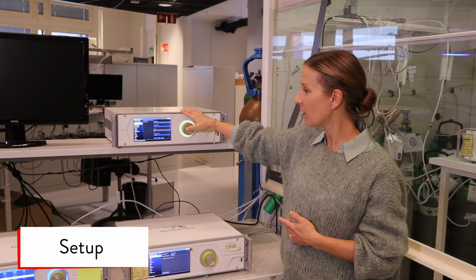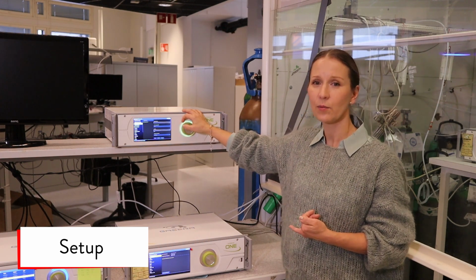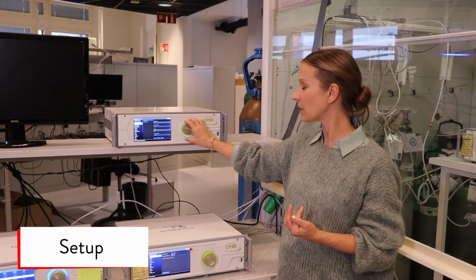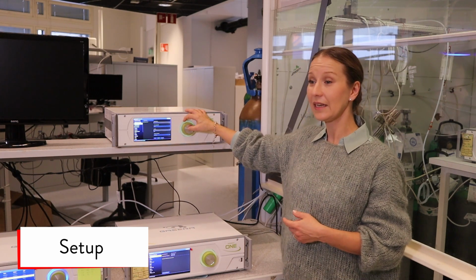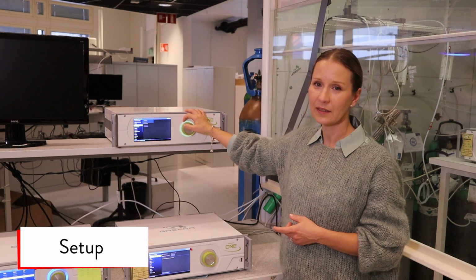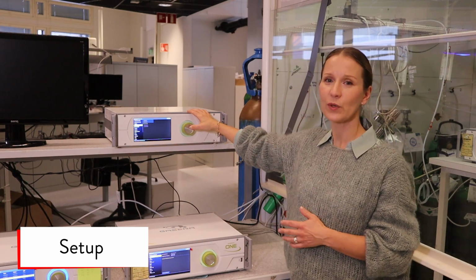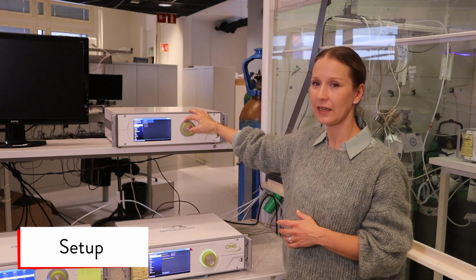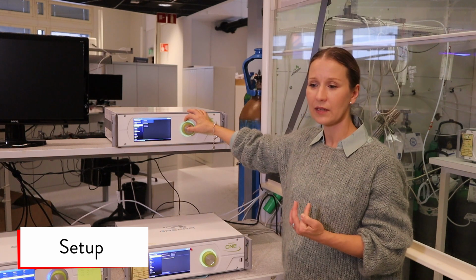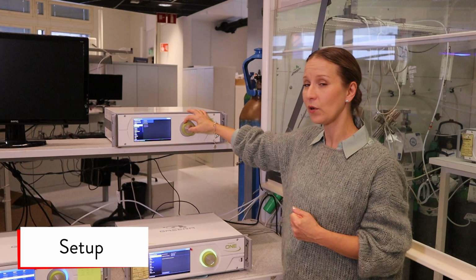Next up are the alarms. You can create an alarm for each component. When the concentration limit is exceeded, the color of the rotating button will change to indicate an alarm. As for the user accounts in our device, there's normally the administrator level, which can do everything in the UI and the setup. But you can either insert the password or create user levels which are more limited.